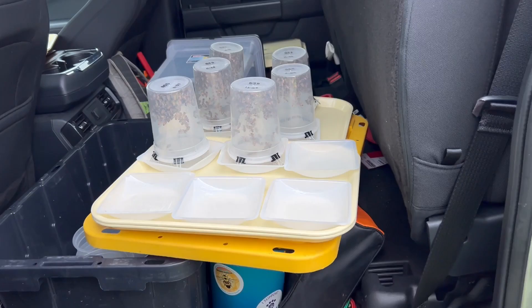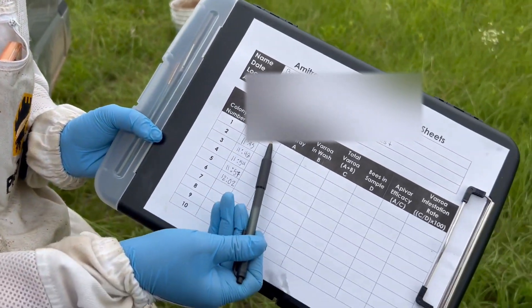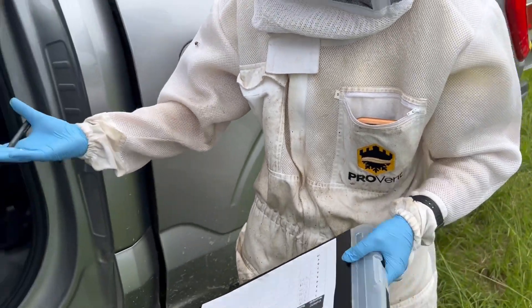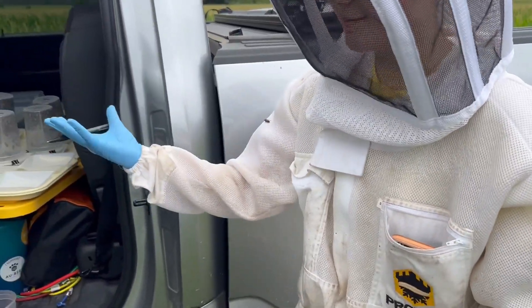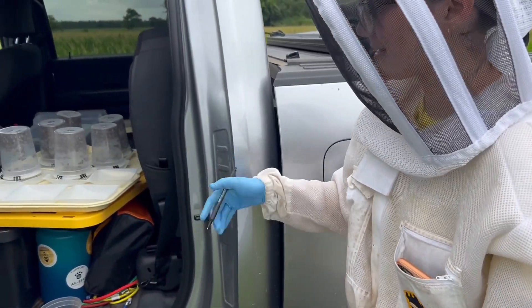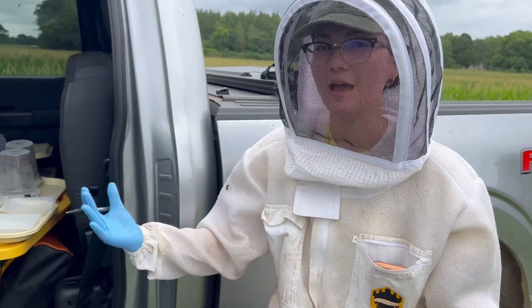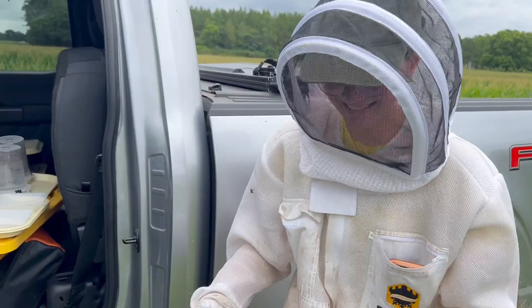I write down the end time, which is three hours later, and when that time comes I take the binder clips off, flip the cup up, and the thought is that all the mites that fell in those three hours were affected by the Amitraz.